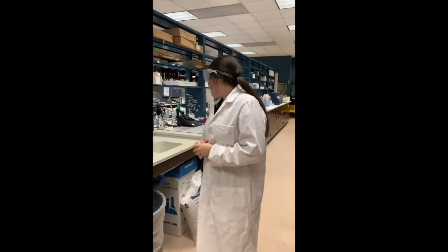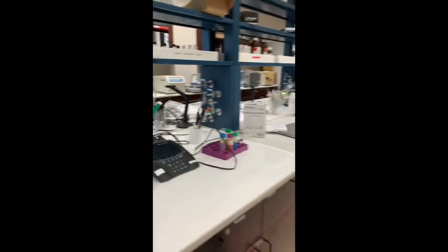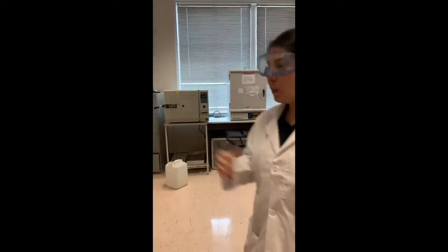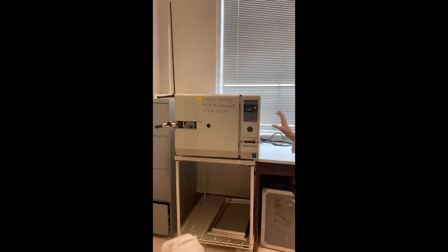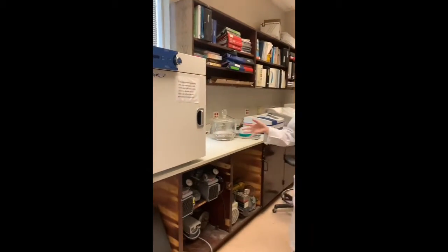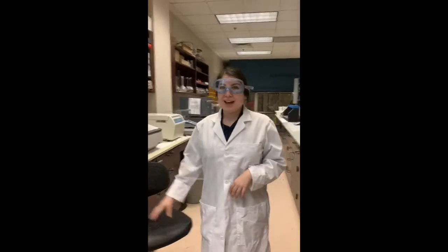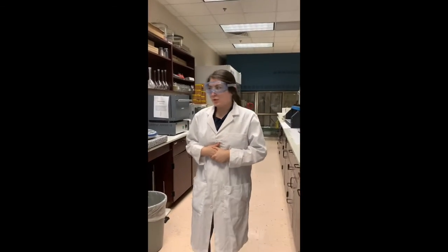So something else that our lab is affixed with is pH and DO meters, and this is used in order to gain a better understanding of water quality parameters. So if we come alongside this area here in our lab, we can see other instruments that we have. So our lab is equipped with an autoclave, and this is used for sterilizing some of our equipment. If we come down here, we also have ovens for curing and drying, and we have a spectrophotometer, which is used in order to calculate the amount of light that can pass through some chemical substances.